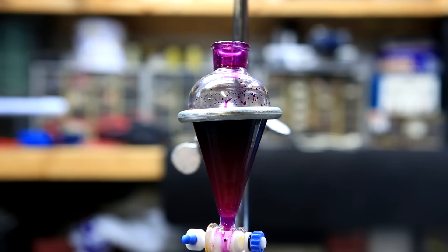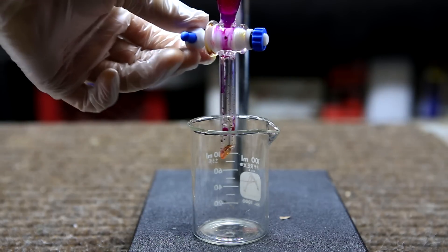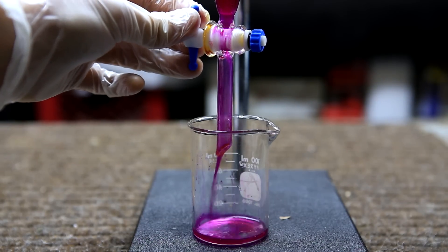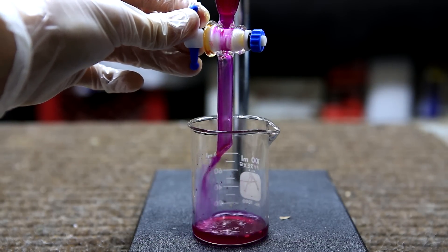Even after leaving it for a while, the layers will be very hard to see, but they are there. The lower layer, which contains some phenolphthalein but mostly unreacted phthalic anhydride, is drained.